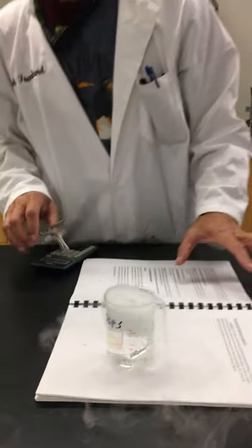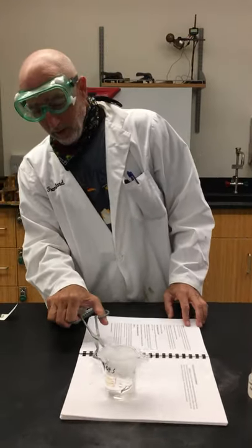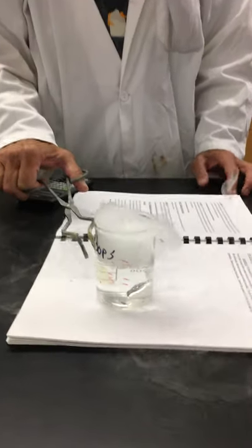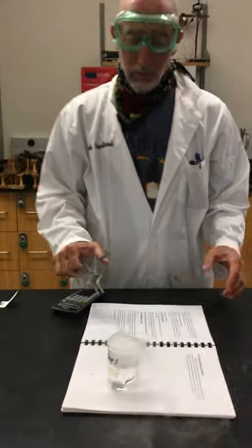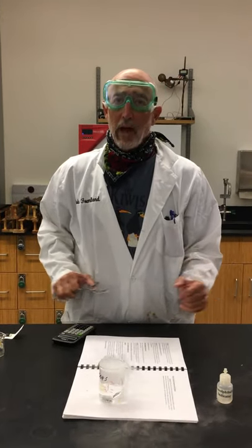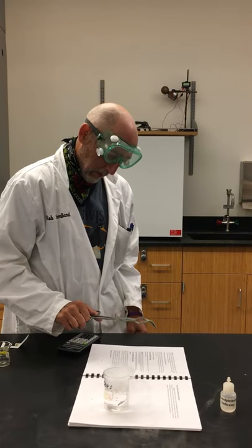Double, double toil and trouble, fire burn and cauldron bubble. You didn't think you were going to get Shakespeare along with this. But what you can see is the color of the phenolphthalein has turned from pink to colorless, indicating that there is no longer any base in there. So something must have reacted with the base, and again on the whiteboard you'll see the reaction that we're talking about. So that's it for this particular activity, which is activity number three.